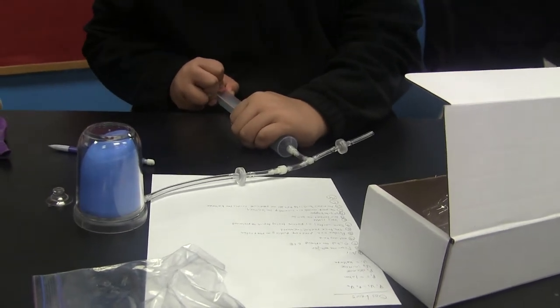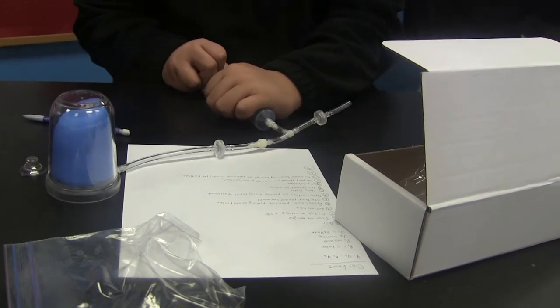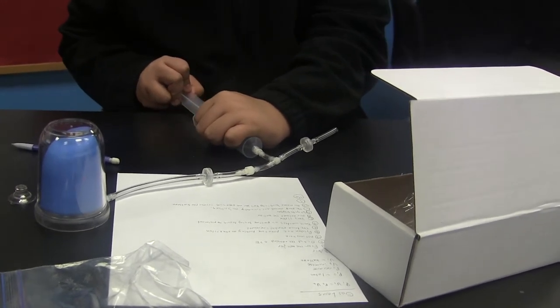More. Oh! We're going to do it again. Later. We're drinking later. Just caution. Then it pops.